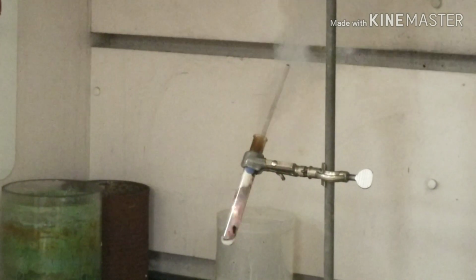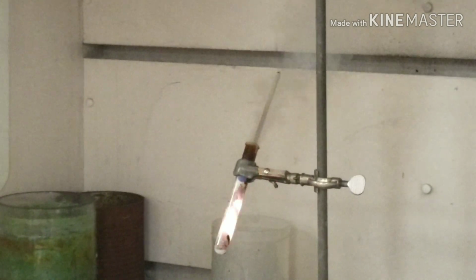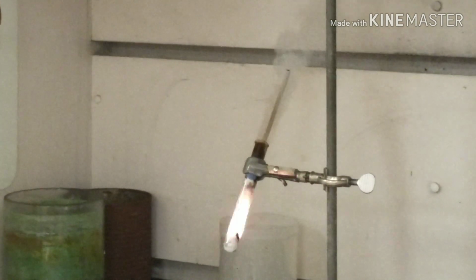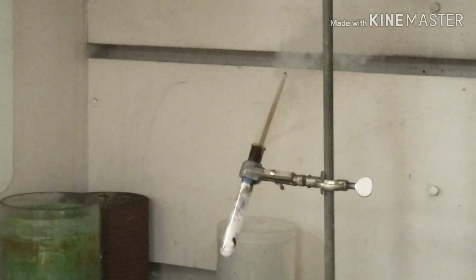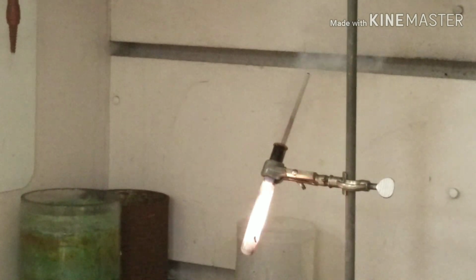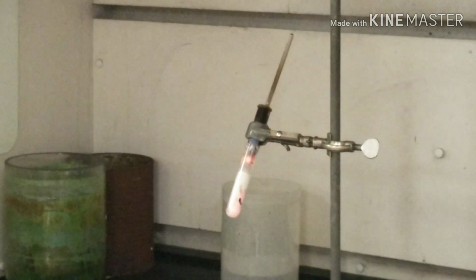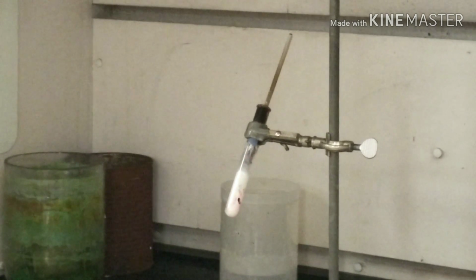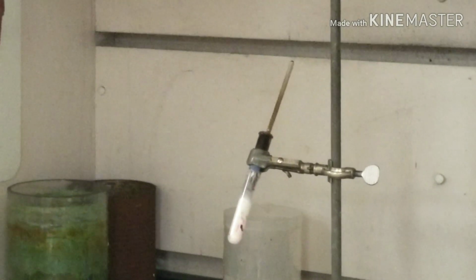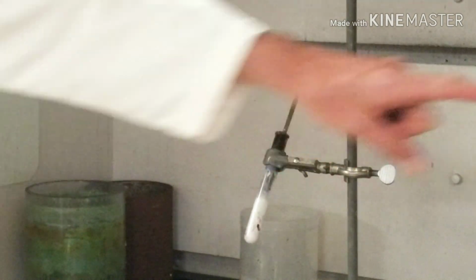That's some major heat going on right there. That is that energy, the chemical energy stored in that gummy bear, really the sucrose. And it's still releasing energy. You notice there's a little bit of that pinkish purple color, indicative of the potassium. If you remember, we did the potassium chloride flame test. That would have been similar to that potassium flame test that we did. Turn the fume hood off.